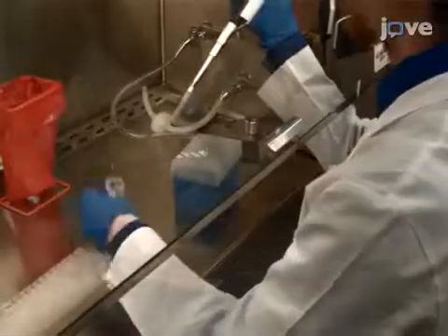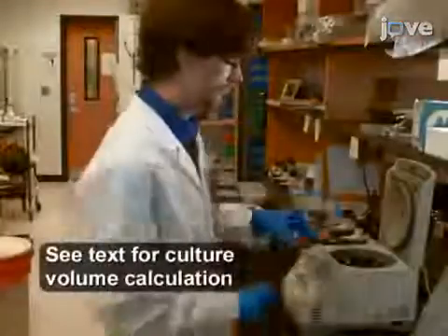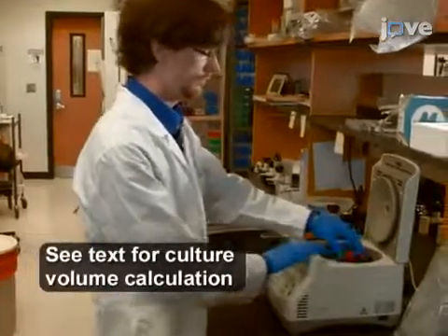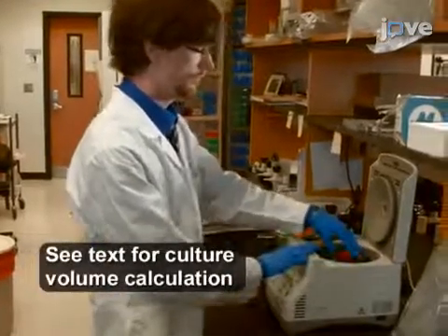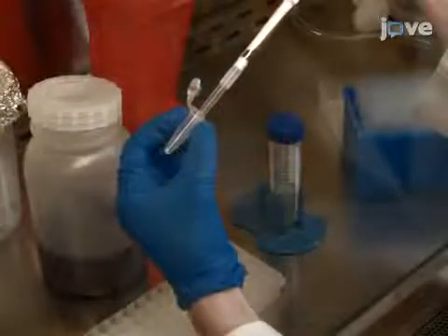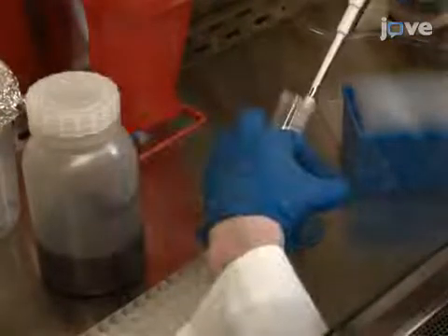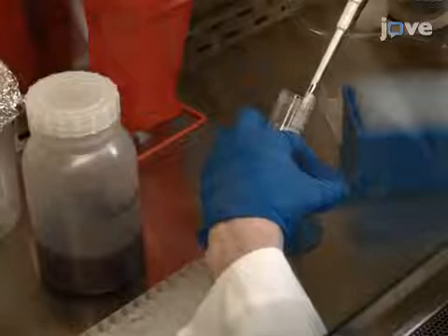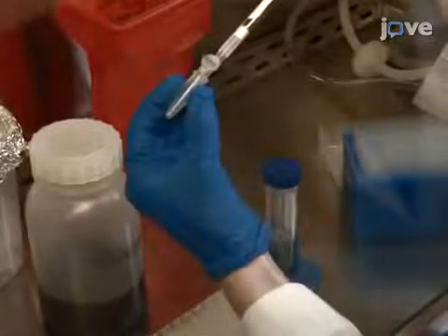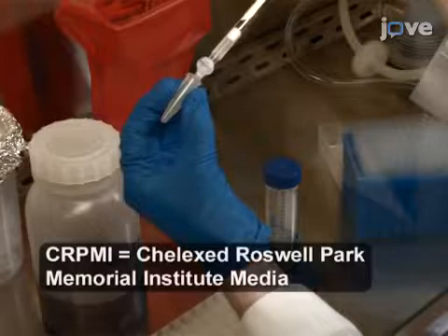Add the calculated culture volume to a centrifuge tube and pellet cells by spinning for one minute at 10,000 Gs. To prepare the biofilm inoculum, aspirate the spent growth medium and re-suspend the cell pellet in 20 milliliters of CR-PMI.